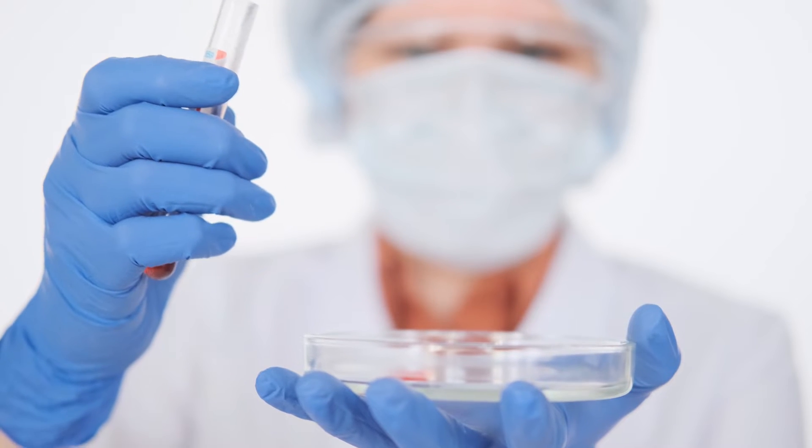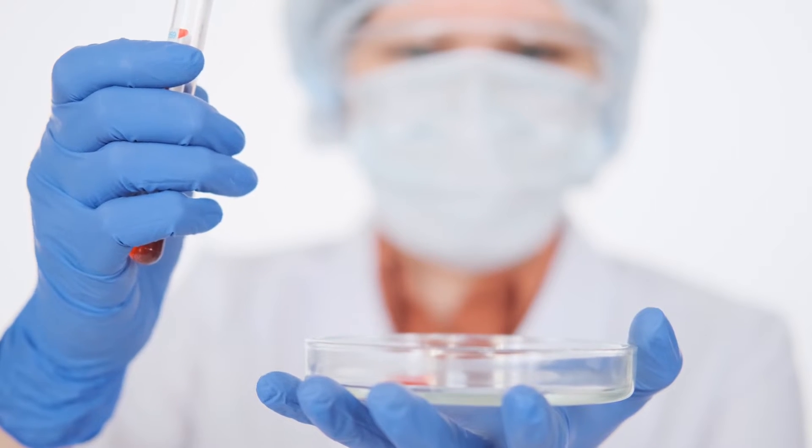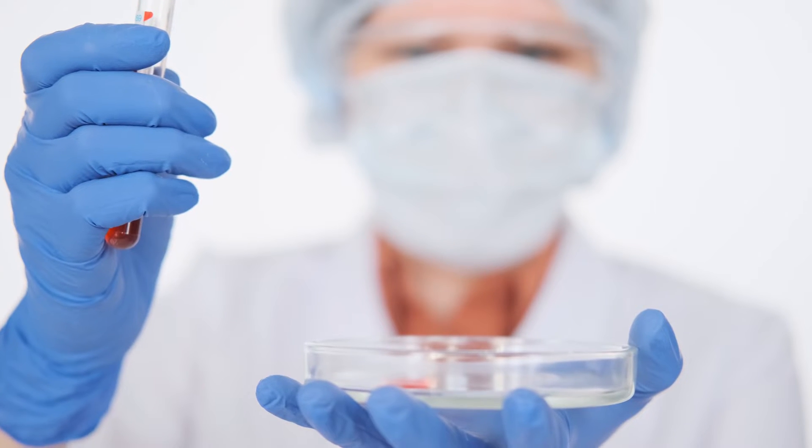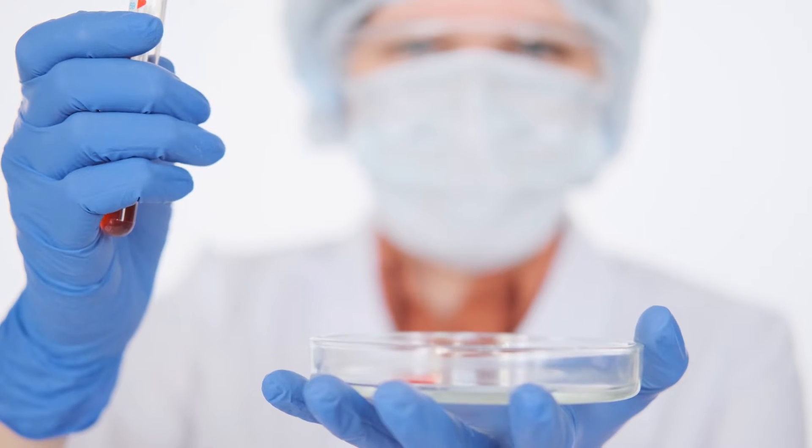The reason you might wish to use agar is that it can support and select for a small number of yeast cells, a good way to harvest rare, not available, or temperamental yeast strains, where you could just swap out to another yeast strain that will not die.